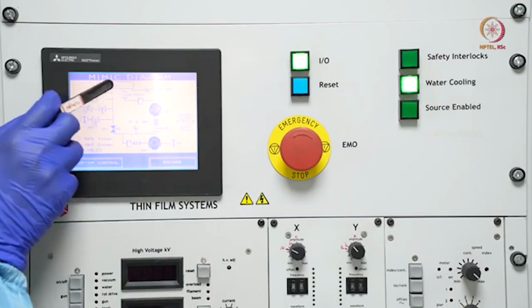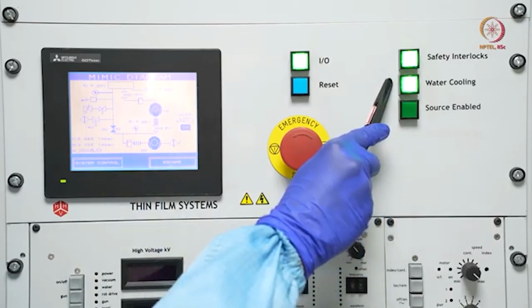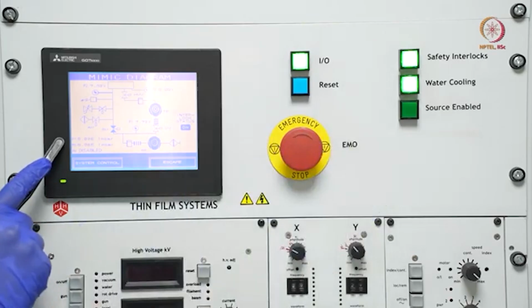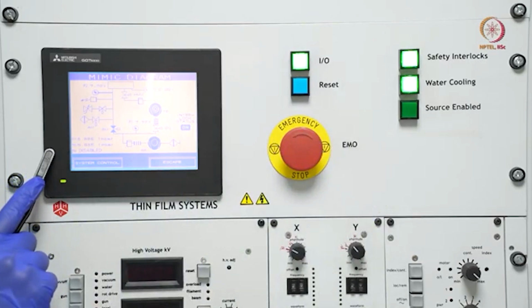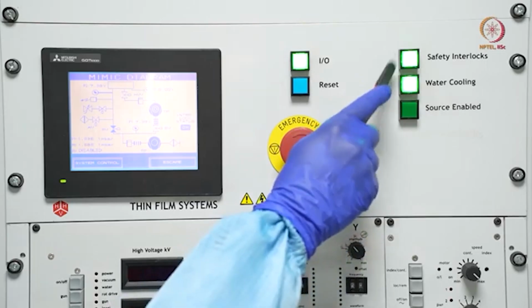So it is creating vacuum from this chamber to this line, and by this time you could probably notice that this safety interlock is on. So this requires at least 10 power 1 millibar pressure. So it should be almost like 100 times less than the environment pressure, like atmospheric pressure. Then only this environment is a little safer for the user to go for deposition or other things. So that is ensured by this.